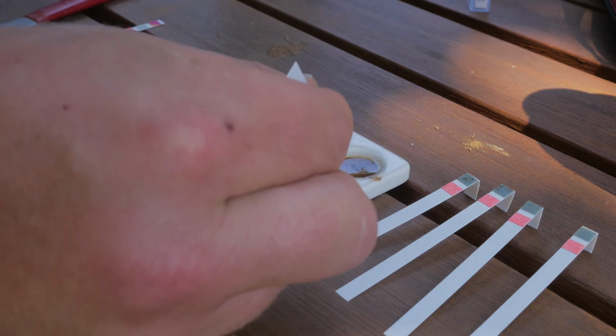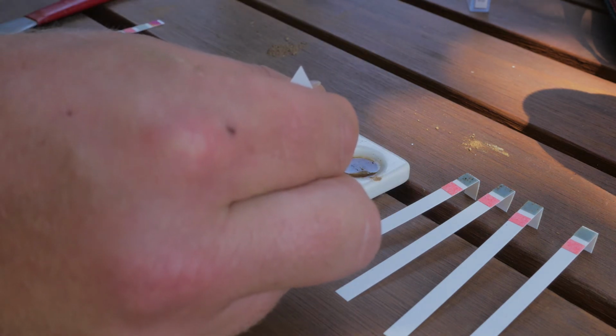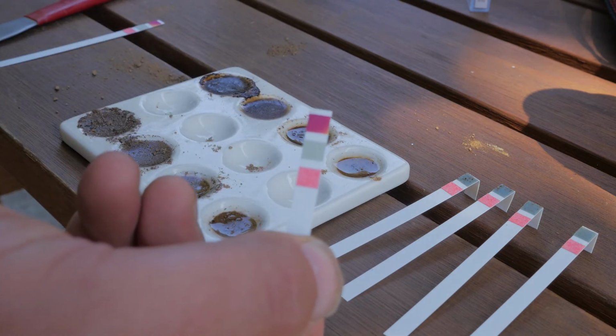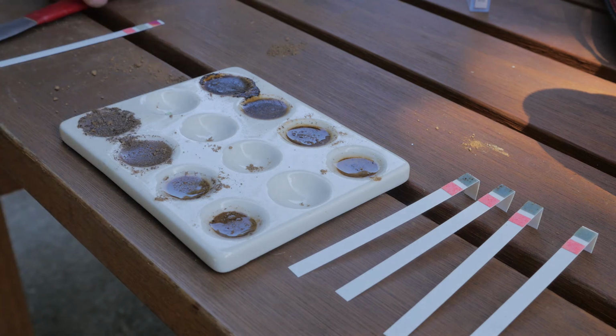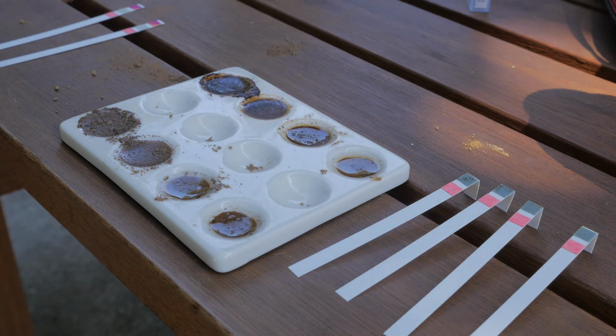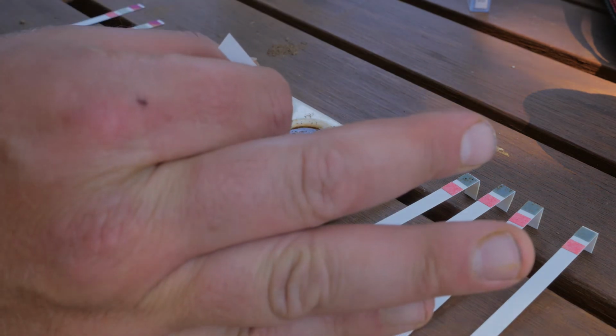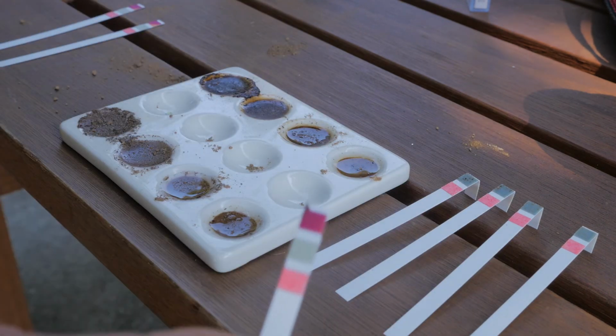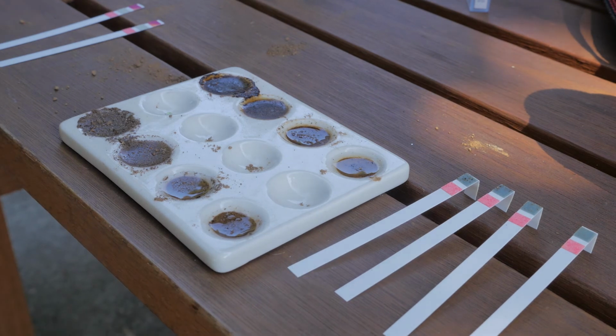Next one. Again, really heavy reaction with the sodium fluoride. Remember, if it's above 9.5, I believe, it's an indication of andic soil properties. We'll do this next one. Again, that's a 10. Maybe even a little darker. Okay, last one, surface horizon.